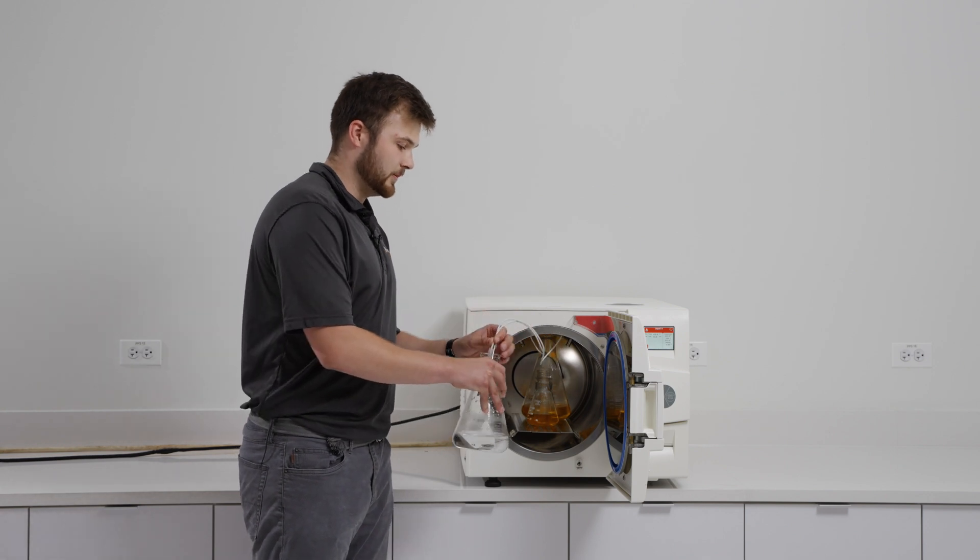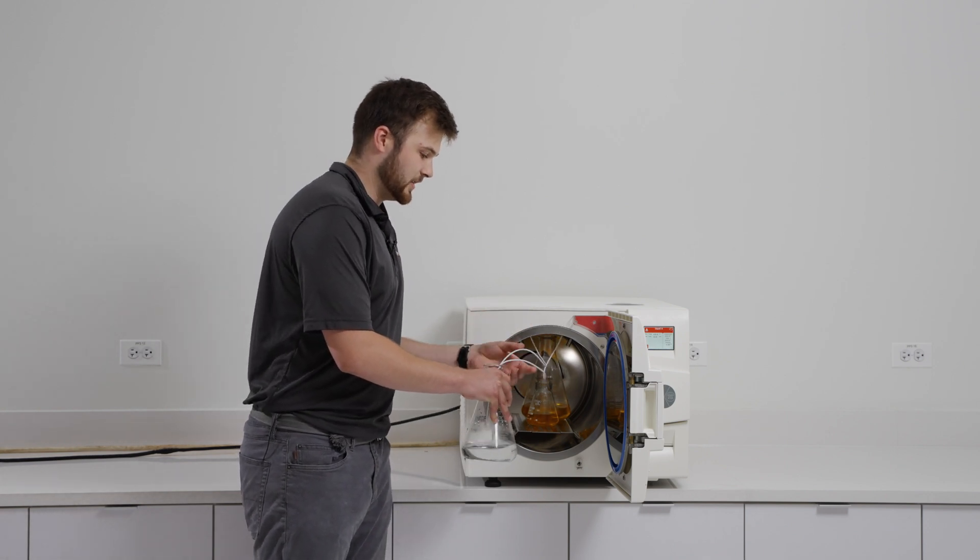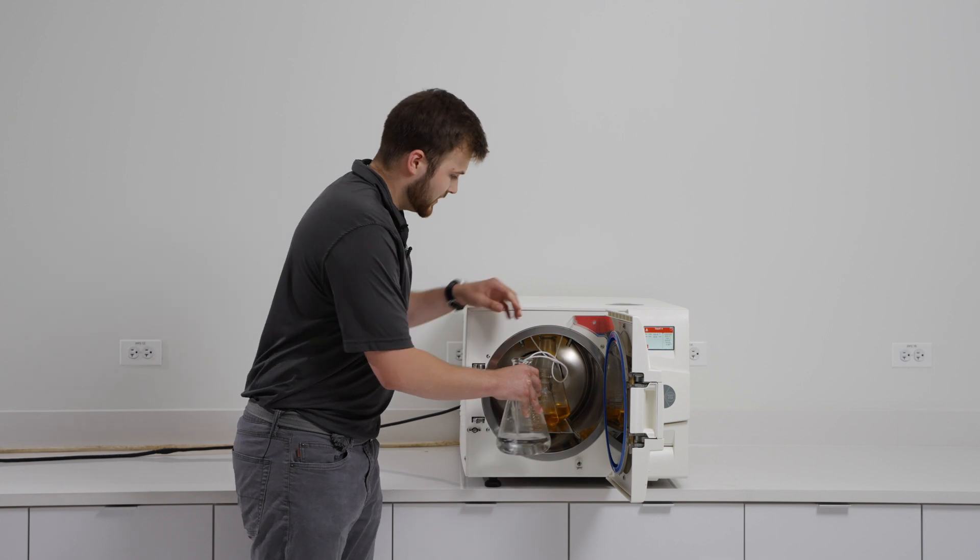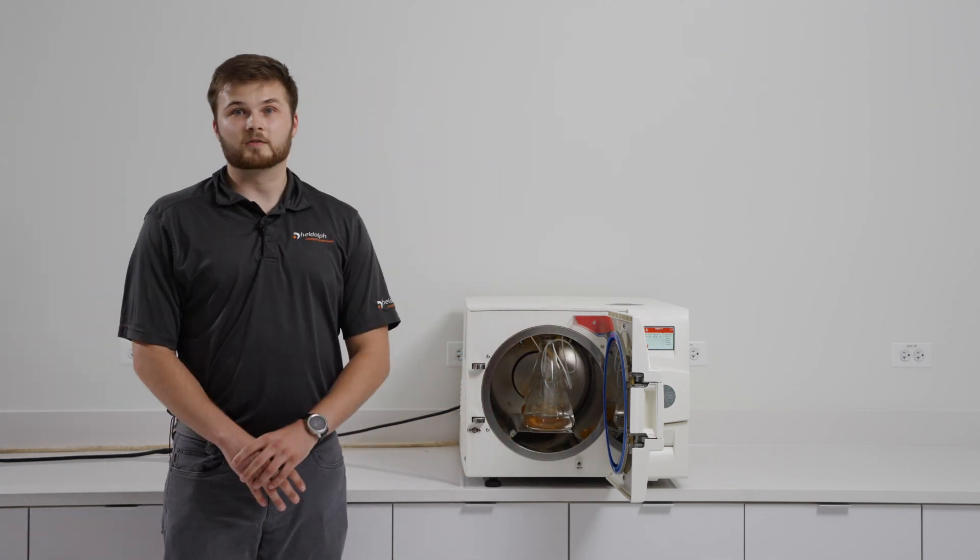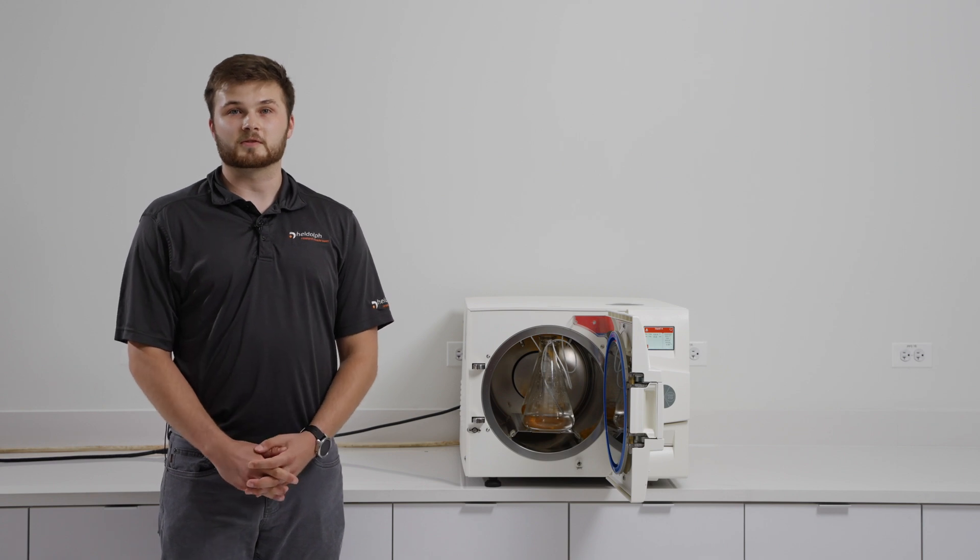We want to make sure that both temperature probes are put in the same vessel. This is because the probes are used to confirm the reading of each other to help ensure successful sterilization.